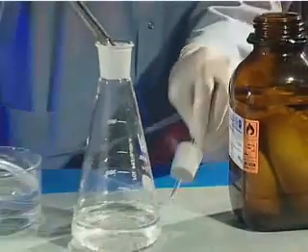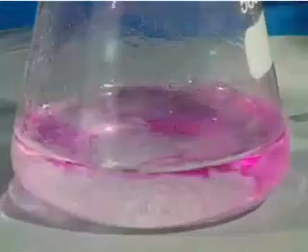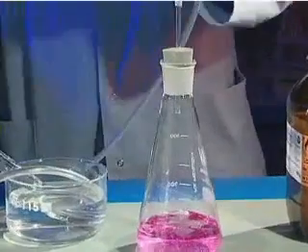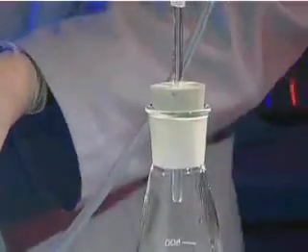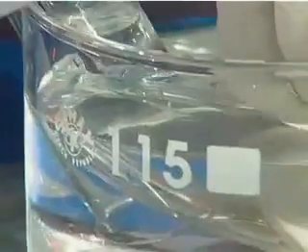Sodium reacts violently with water at room temperature. During the reaction, a large amount of energy is released. Note that a piece of sodium added to water floats on its surface, because it has lower density. The considerable amount of energy released by the reaction melts the metal.